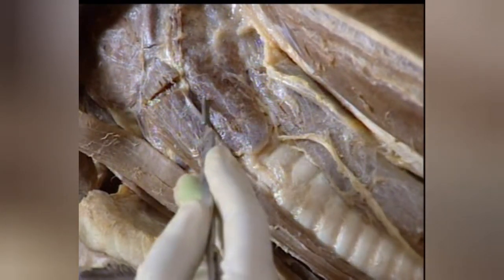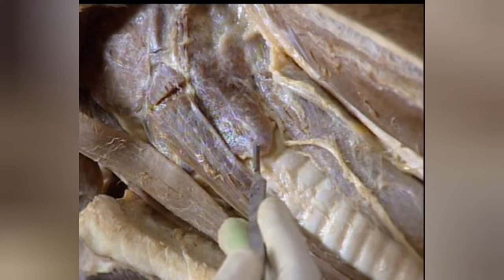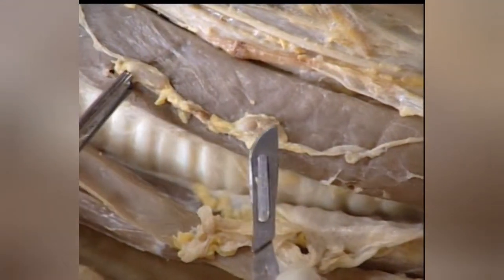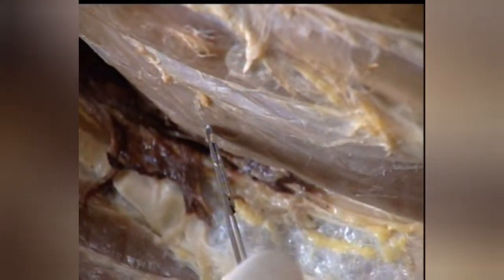Are you able to find a lobular structure on the first few rings of the trachea on its lateral aspect? This is a lobe of the thyroid gland. These nodules situated on the sides of the esophagus are the cervical lymph nodes, and they are connected with efferent lymphatics. Now the esophagus is cut at its middle and reflected on either side. You can then find the longus colli muscle covering the ventral aspects of the bodies of the cervical vertebrae. It extends up to the bodies of the first six dorsal vertebrae.